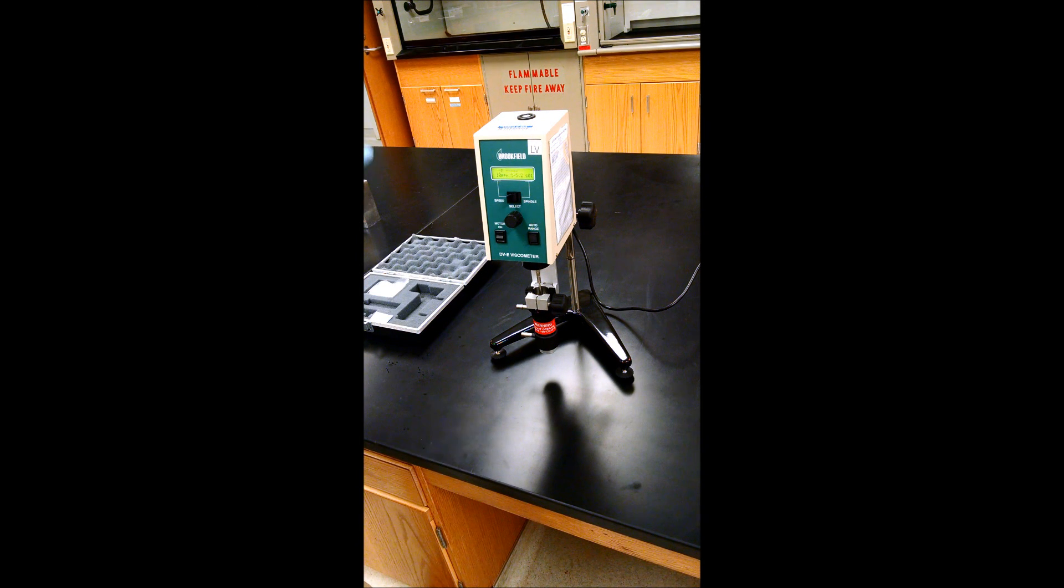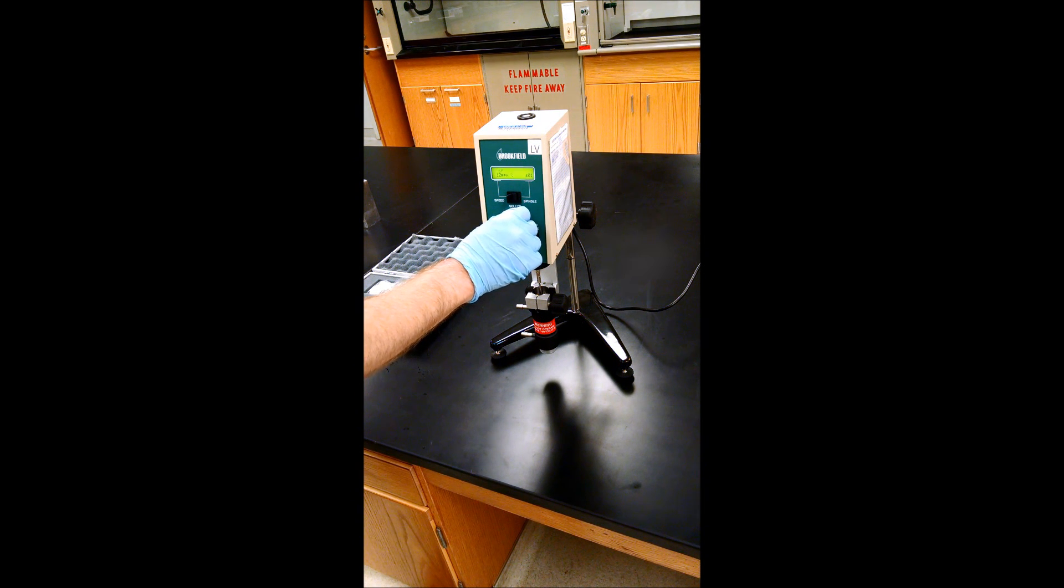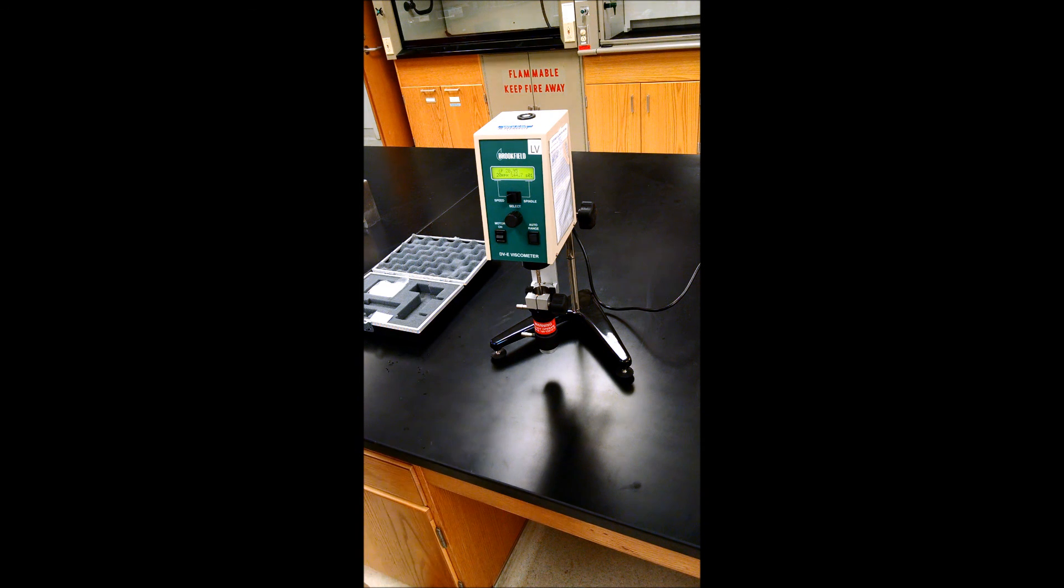Turn the motor on. It has to do a complete revolution so it can start averaging the sample signal. We're still under range, so let's increase the speed. You can do this in the middle of the measurement.